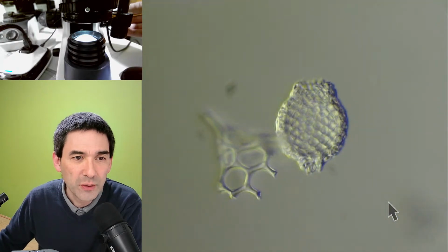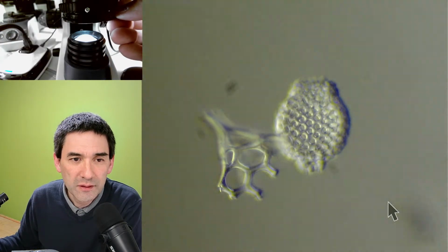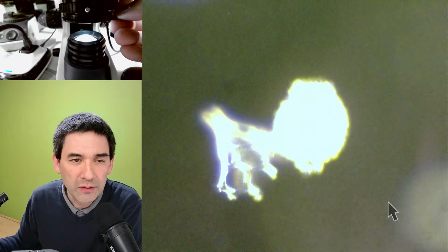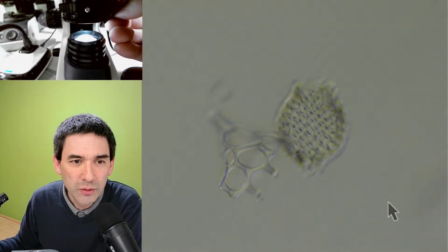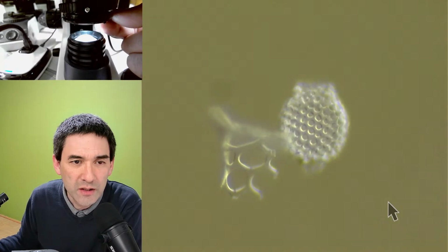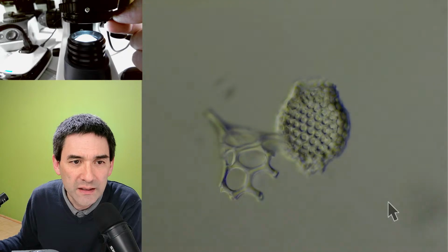It's also quite nice, because the contrast is not quite as sharp. Here we again have the edge of the filter holder right in the center. Now by controlling it, we can make sure there's more light coming from the side. So I have to rotate the filter out again a little bit.